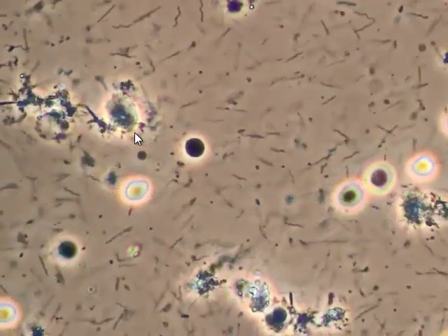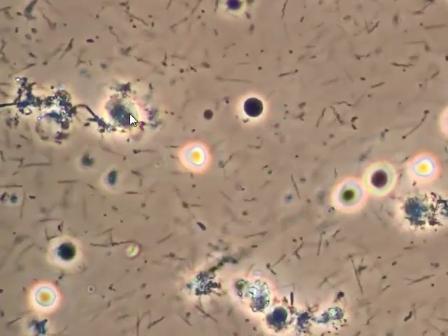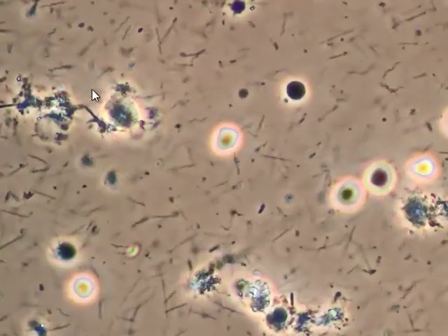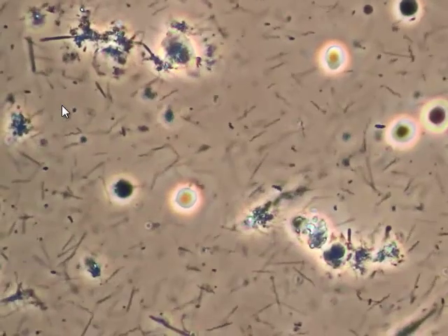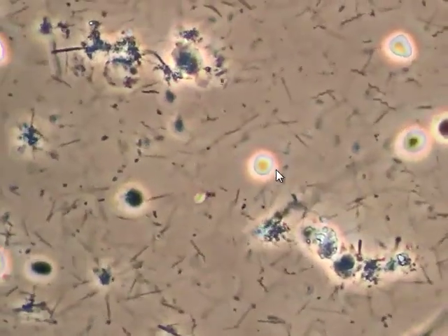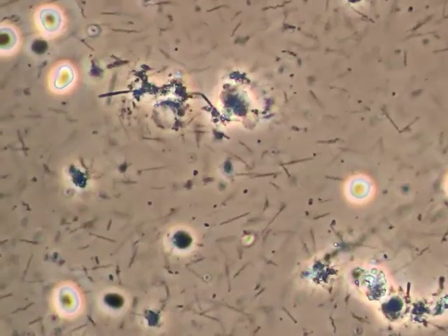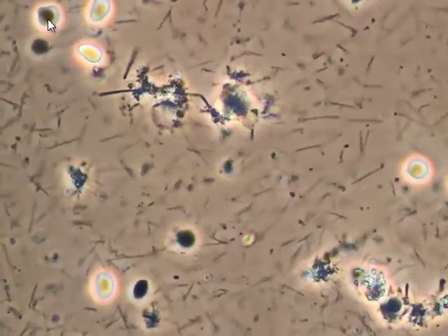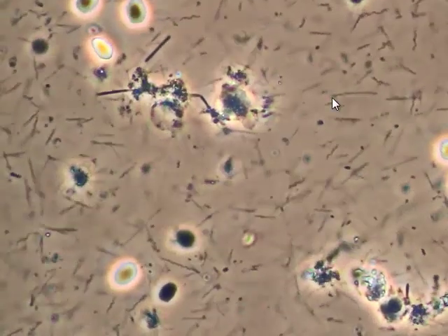These white blood cells in this area here — all the spirochetes around them kind of organize and swarm around these live cells. Here's a good example of that. And here are some red blood cells floating through the sample, showing how they've been distorted and changed.